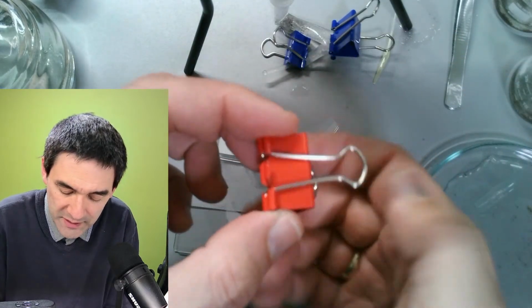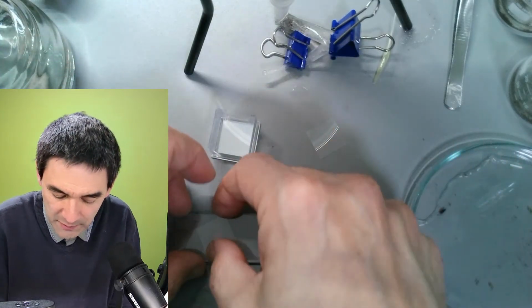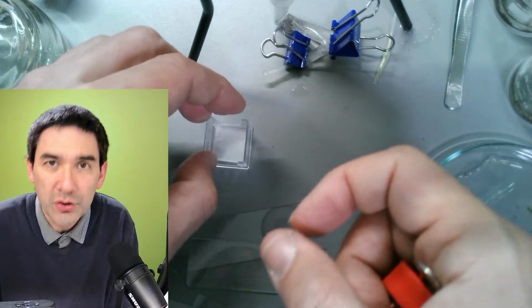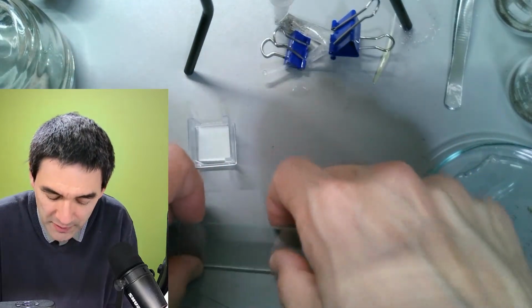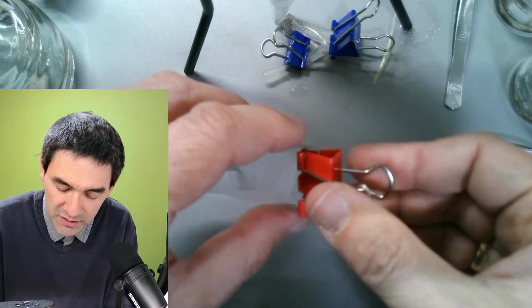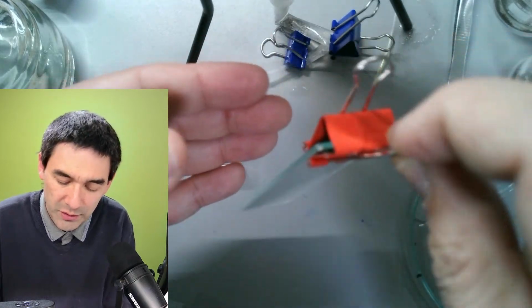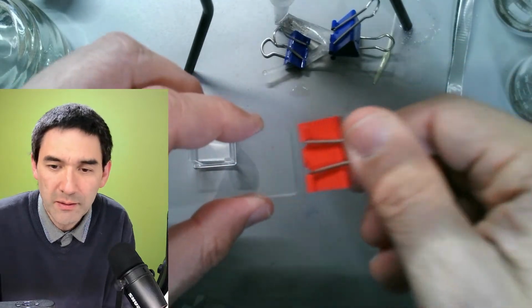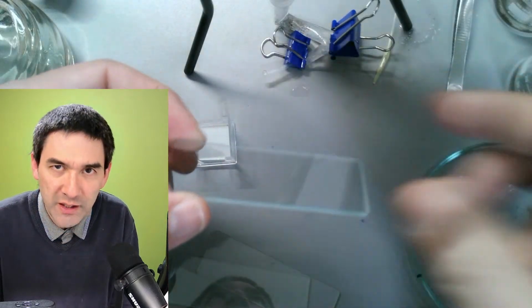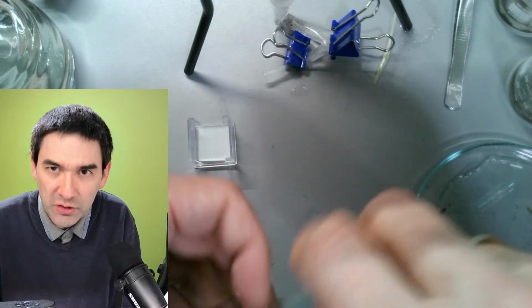I don't know to what extent they are stainless or not, or whether they're going to start rusting. I don't know about that. But that is the reason why I bought them. And so you see that these are some of the other projects that I'm planning out or experimenting with. But the first thing I'd like to do is just clamp them together and attach a string here, and then hold it in some water for a couple of weeks maybe. That's the reason for biofilms, because of course you can try to scratch material off a surface, but then you're destroying the biofilm.